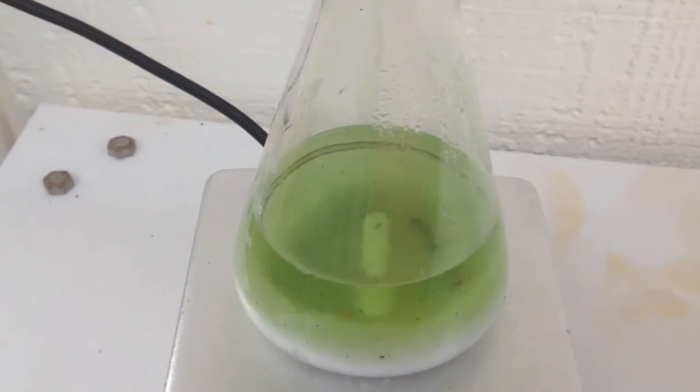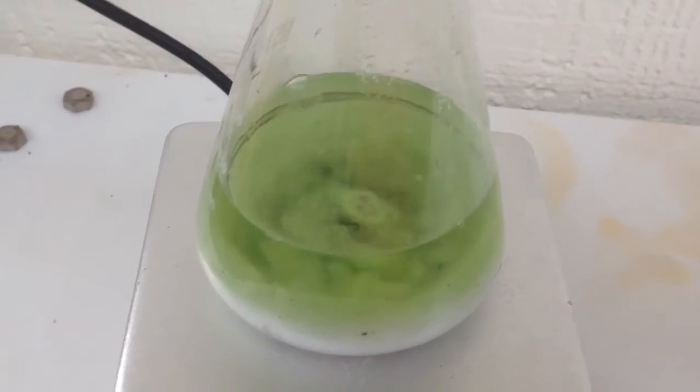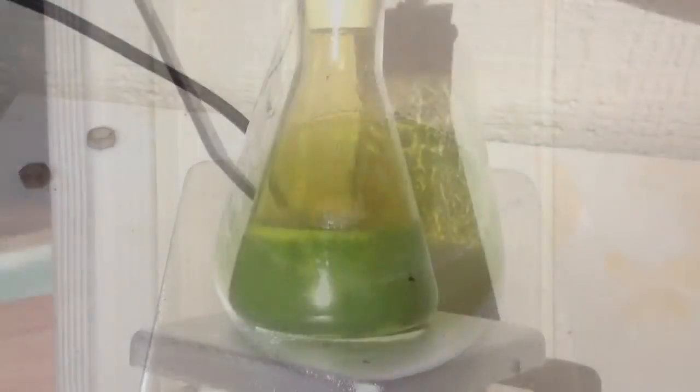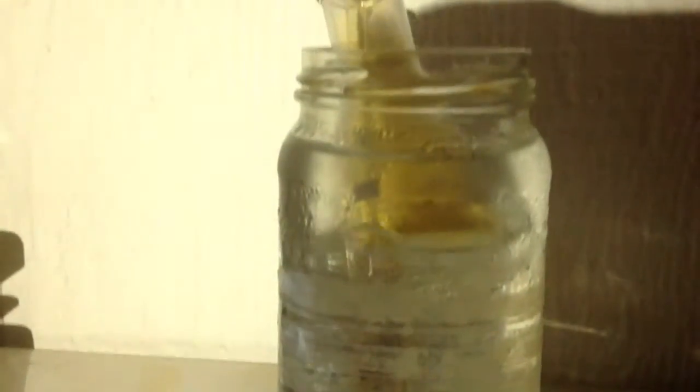Finally, put the mixture on a stir plate so that all the material can mix. Okay, so I just ended up heating the mixture because just stirring it didn't produce any nitrogen dioxide gas.